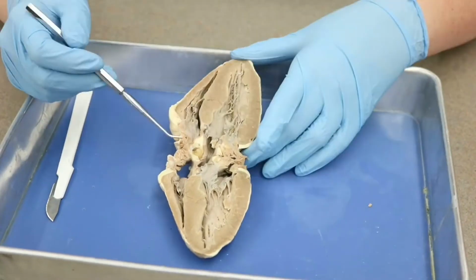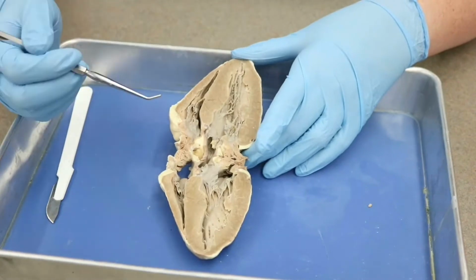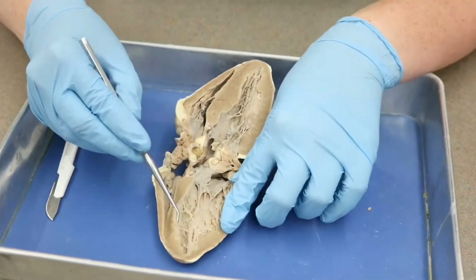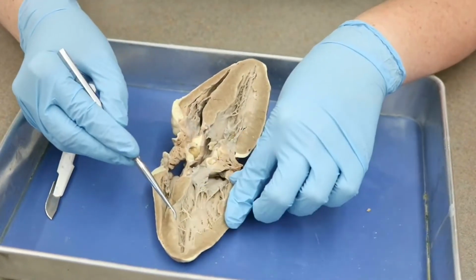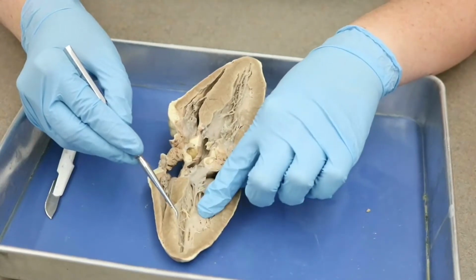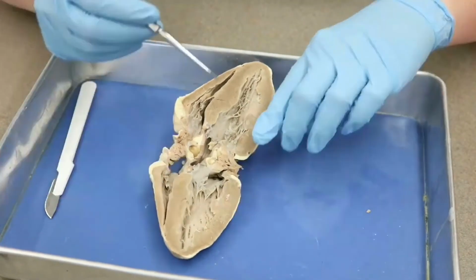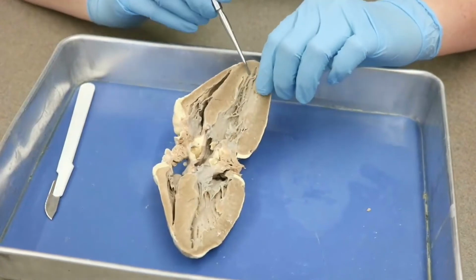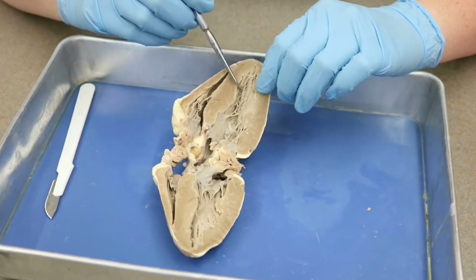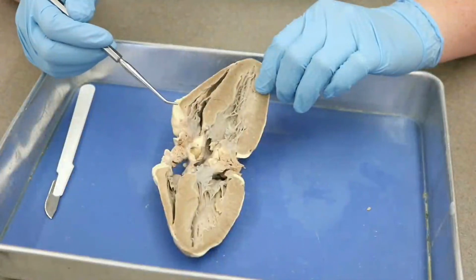All right, guys, so we just need to go back to two other terms that we didn't mention previously. The first one is going to be our trabeculae carneae. So I'm going to go a little further down here, and you see here on the ventricular tissue that these are the papillary muscles up here, but there's all of this rough tissue around it. You can also see it up here. So there's rough tissue in here. So that is our trabeculae carneae. So trabeculae carneae, it just looks like rough tissue within the ventricles, okay?